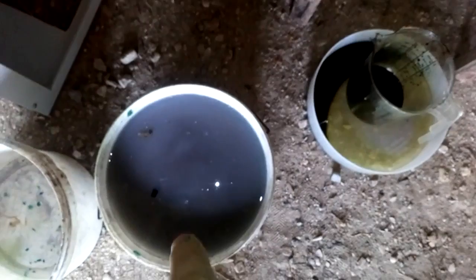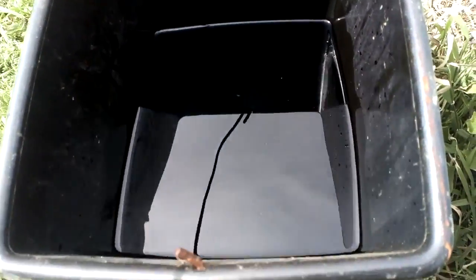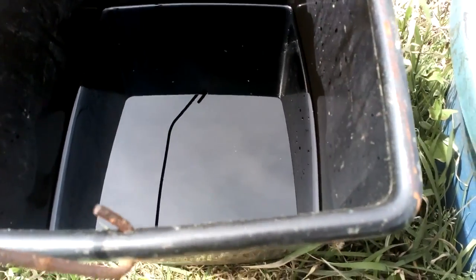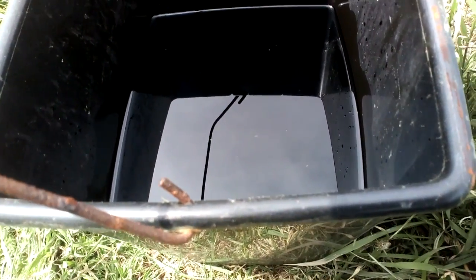Here we got a bucket full from washing the little board and on the bottom we got some gold. After we filter all this we will filter it and go to aqua regia. This AP goes to the next batch — we will add some new fresh HCl, about 5 liters, and add this old AP to repeat all the process. From the 5 liters removed, we'll put some iron inside to cement some copper and recover it — nothing goes to waste. I'll show that process in a future video.